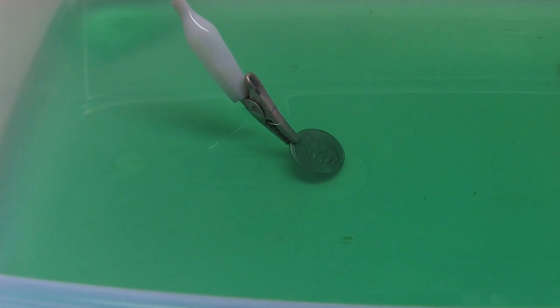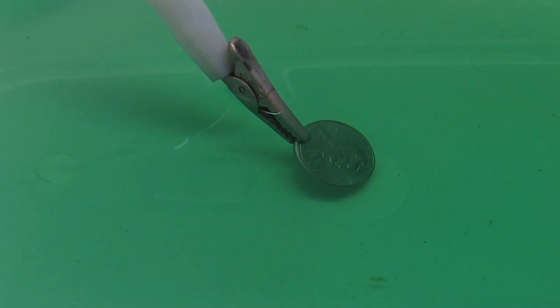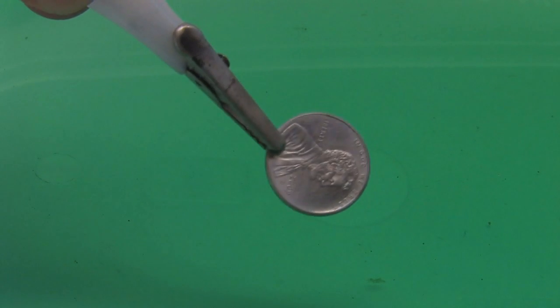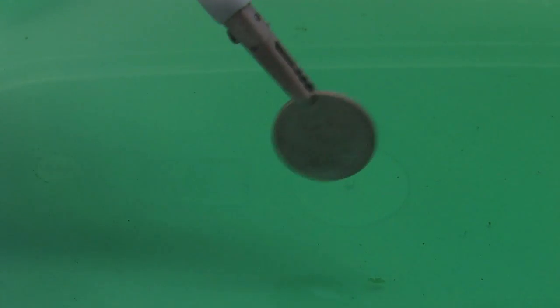What's really neat about using these low voltages and just taking your time to plate it, is you don't really get any bubbling in the solution, and your piece comes out. Check this out, look at that perfect shiny nickel finish on the whole penny.